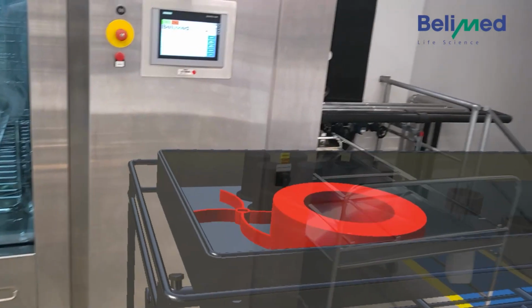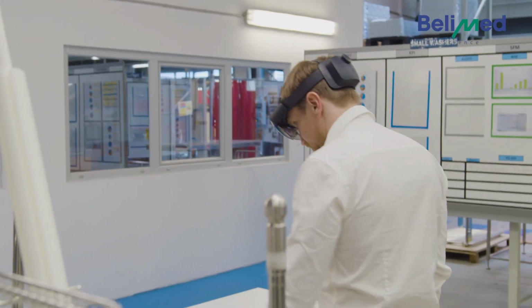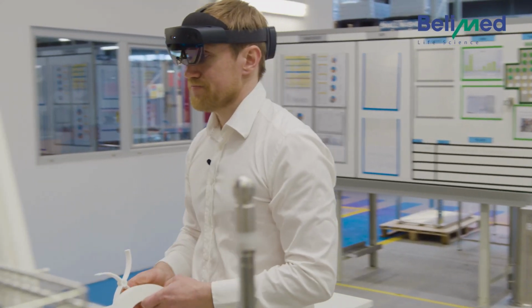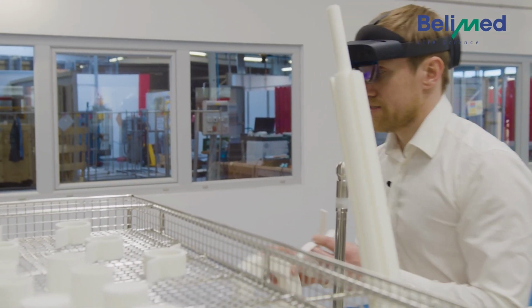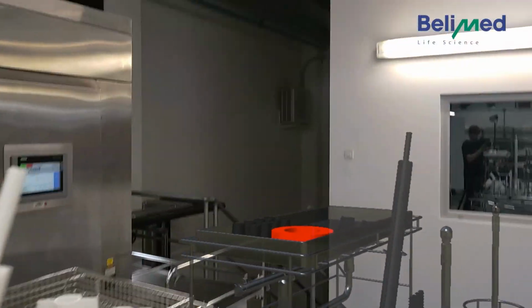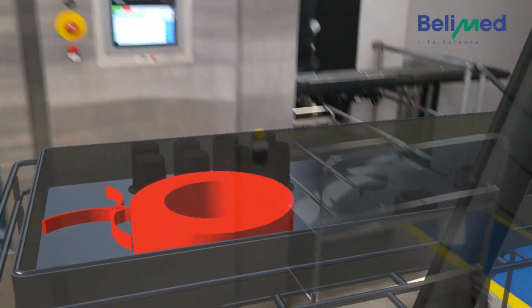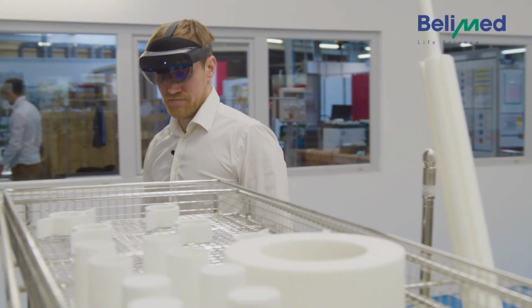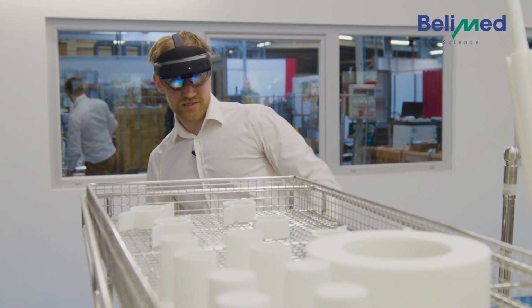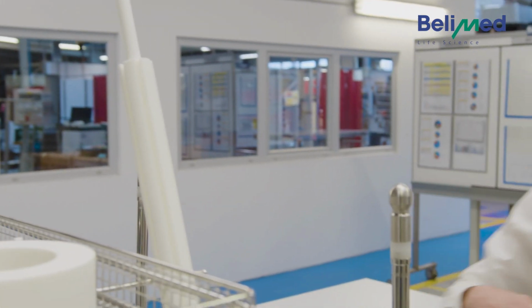So we have again two parts, a big round one and something that looks like a propeller. This one and this one. We place it directly in front of here. And this part next to it. So here we can see this side is facing downwards. Currently here we have it upwards. So we turn that around.